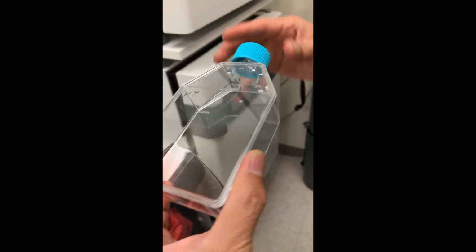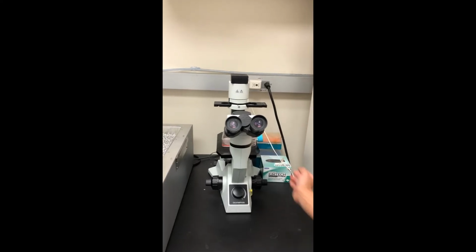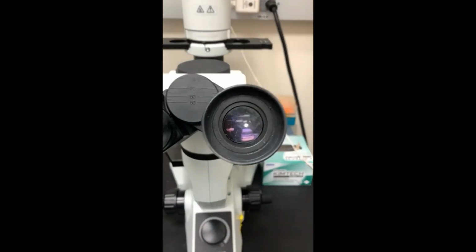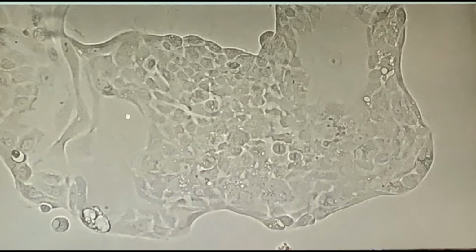Oops, got a glare. There we go. And here's a microscopic view of this actual cell line. This is how a ROS1 cell line looks under a microscope. You're actually looking at clumps of living ROS1 cancer cells. The little round spots are cell nuclei.